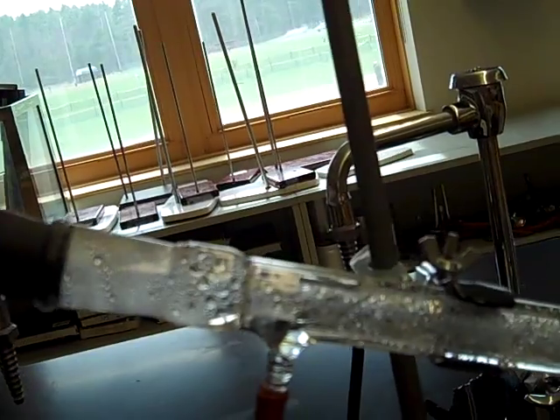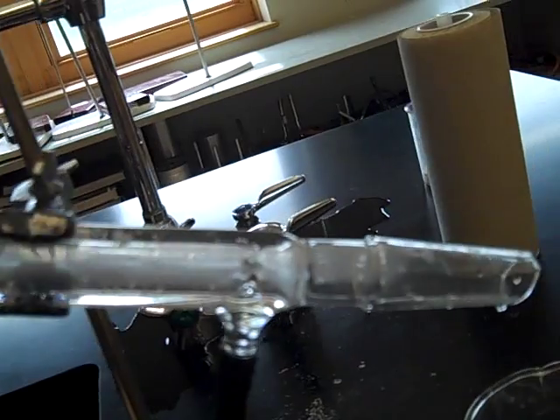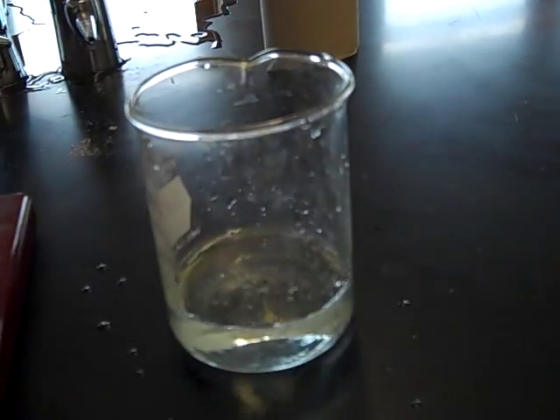condense in the condensing tube because it's cooling down because that water from the faucet, and eventually collecting. Oh, that was a good drop.